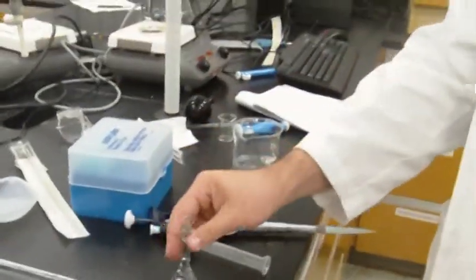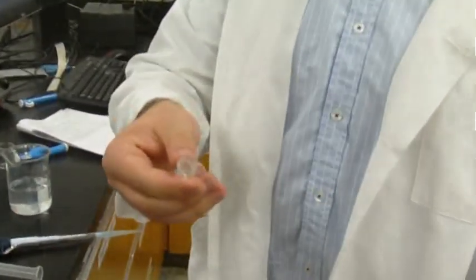Yes, but as you can see, it's kind of small. So what we would do is, before we put any water in there, take a transfer pipette, fill it up with water, situate the weigh boat over the volumetric flask, and pipette water over the copper sulfate and let it run into the volumetric flask until there is no more copper sulfate in the weigh boat. Okay.